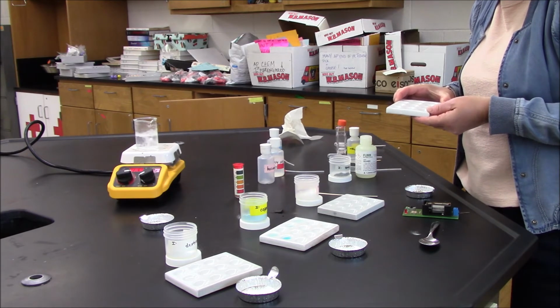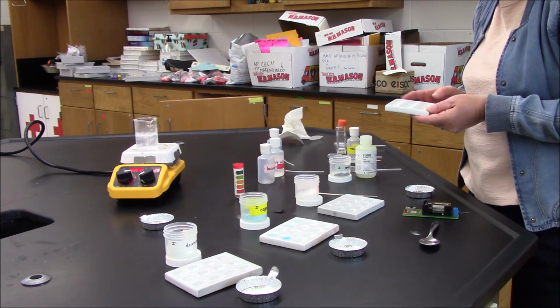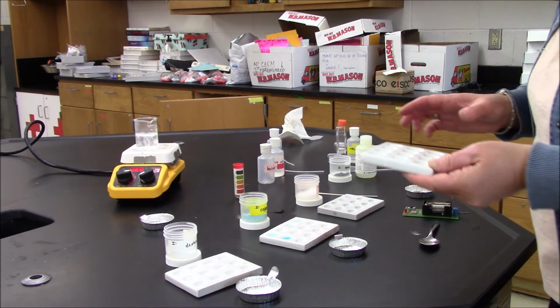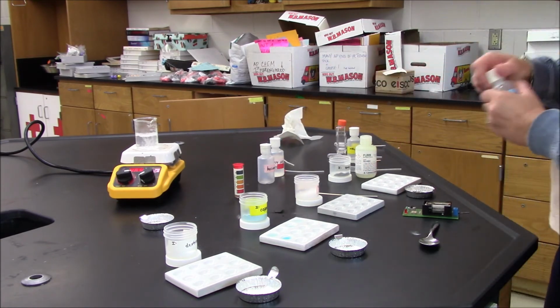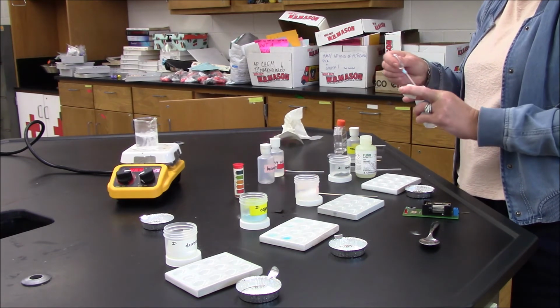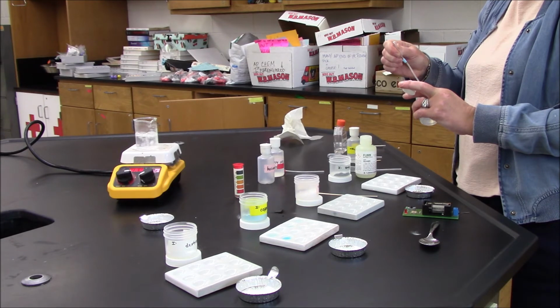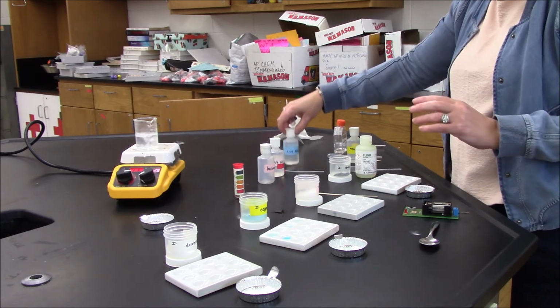It's hard to see because there's really not a lot of metal in here. I don't think you can even see it, so I'm not going to show the camera. But I will tell you that it is happening. I'll check its reactivity with the base, fully expecting that nothing will happen. And nothing does happen.